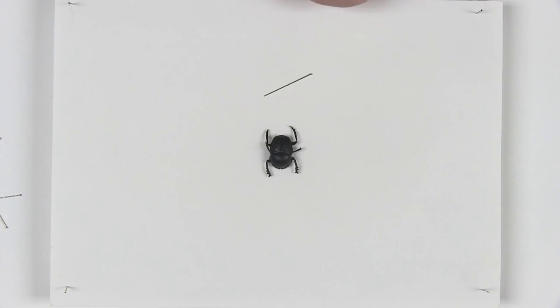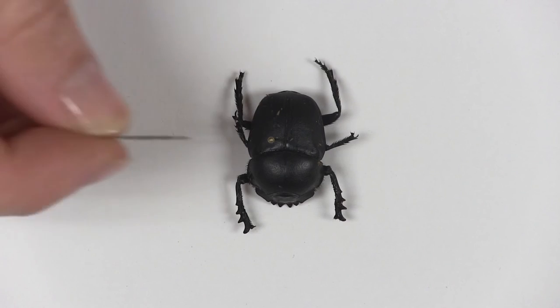Next, pin the insect into a piece of thick foam so that the body can rest flat on top of the foam.